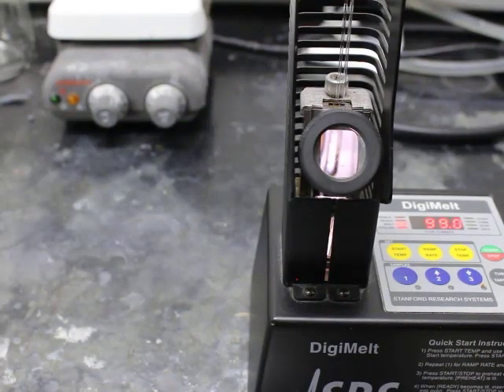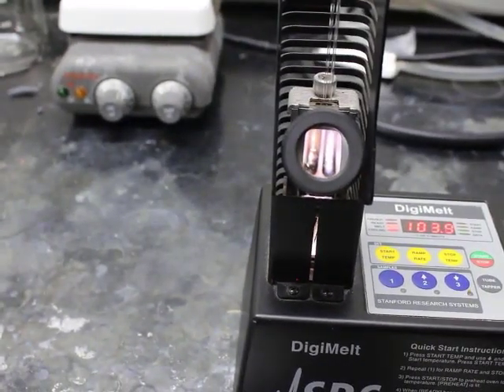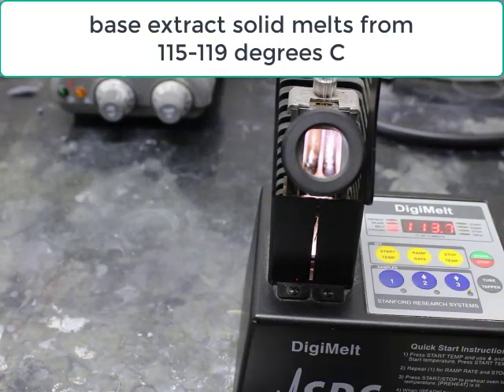All right, so now moving on to the next one. You can see our temperature reading is already about 103. Pay attention to the far right tube, not the middle tube. The far right tube, you can see it's starting to wiggle a little bit, and so the base extract melts from 115 to 119 degrees C.